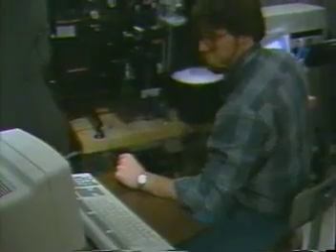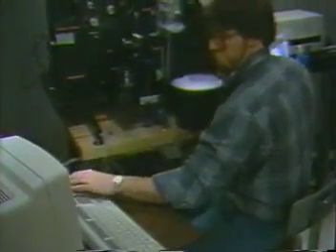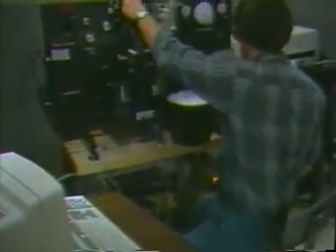When the data collection is complete for sample F1, Keith moves the flashing rectangular cursor to indicate that sample F9 will be next. He then delivers the new sample to the FACS and repeats the collection process.